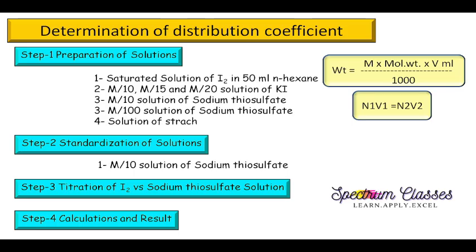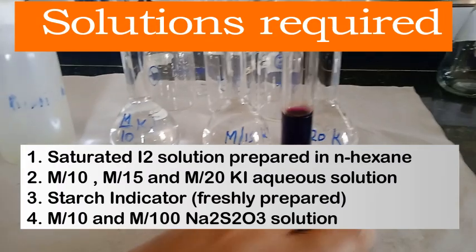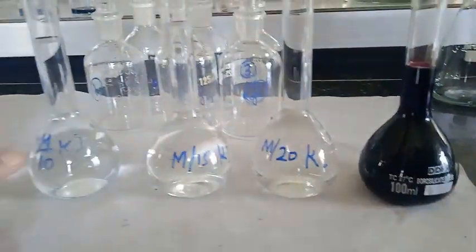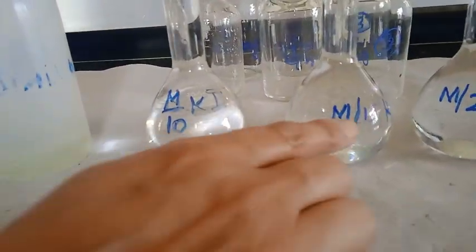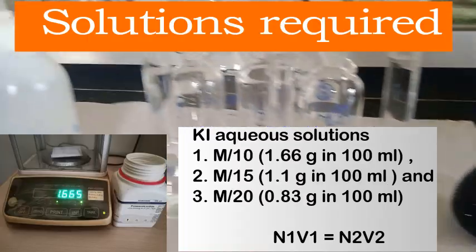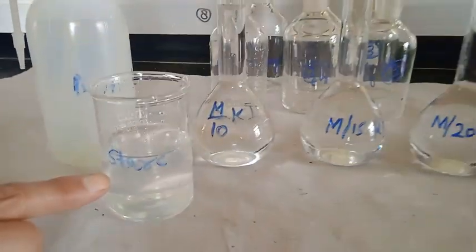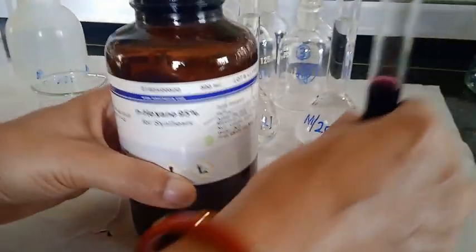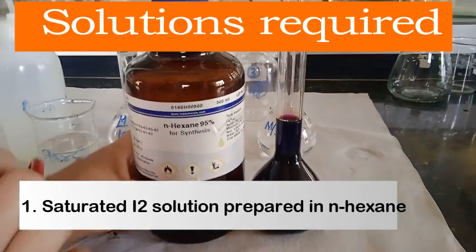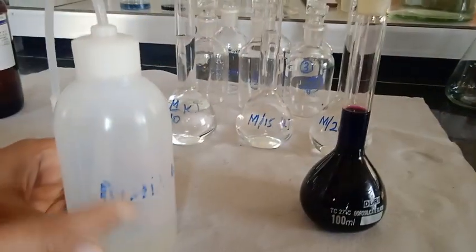Now we are going to perform the lab activity. For this we have these solutions: M by 10 KI, M by 15 KI, M by 20 KI solutions are required, plus freshly prepared starch, saturated solution of iodine in n-hexane, and distilled water.